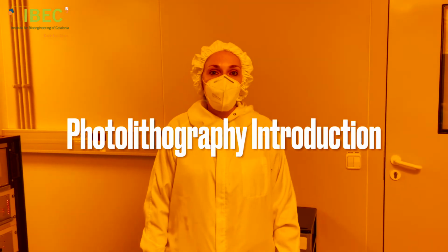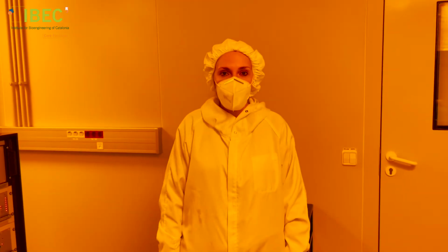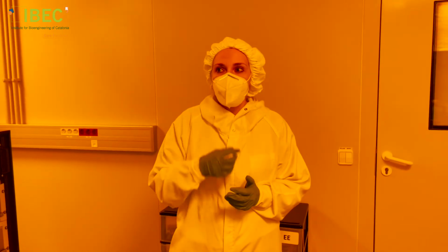Welcome to this introduction to photolithography. In this video, I will explain the main theory and steps to fabricate microfluidic chips using photolithography.